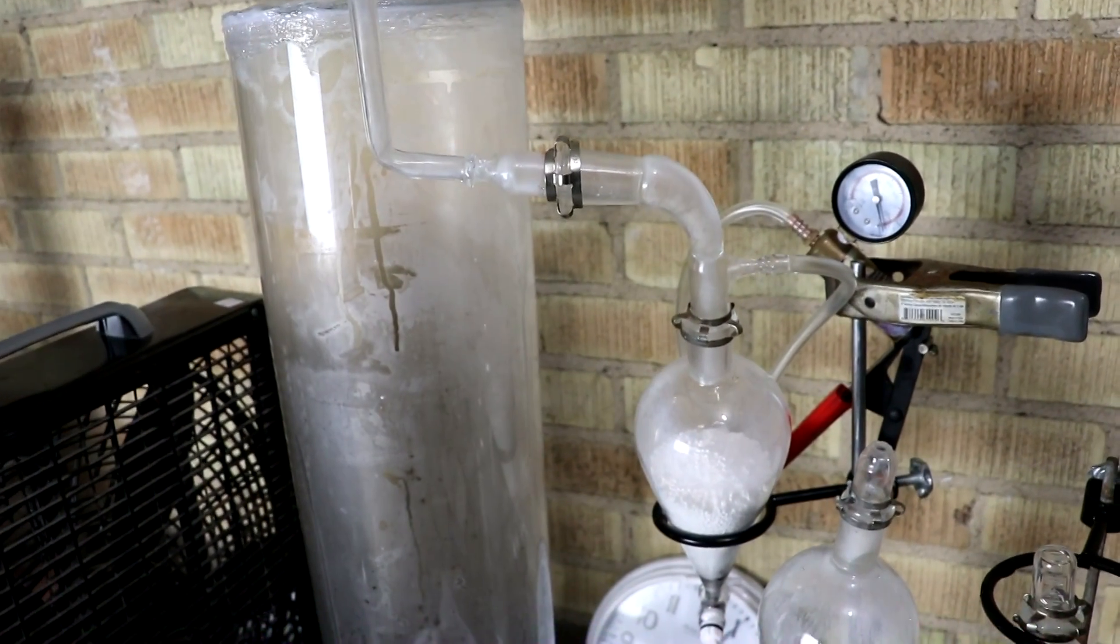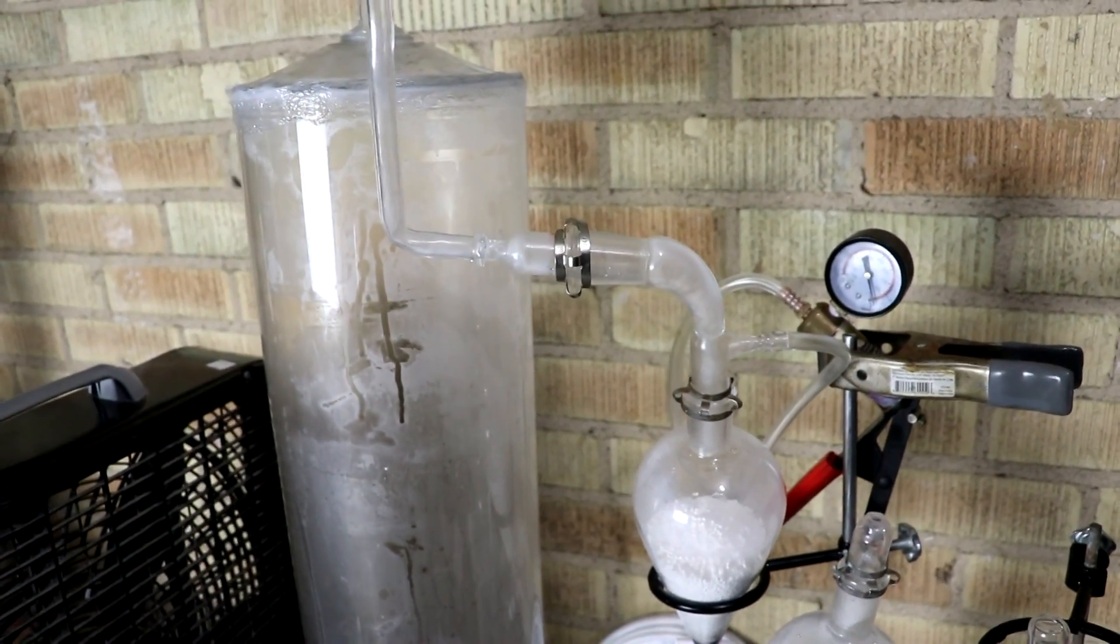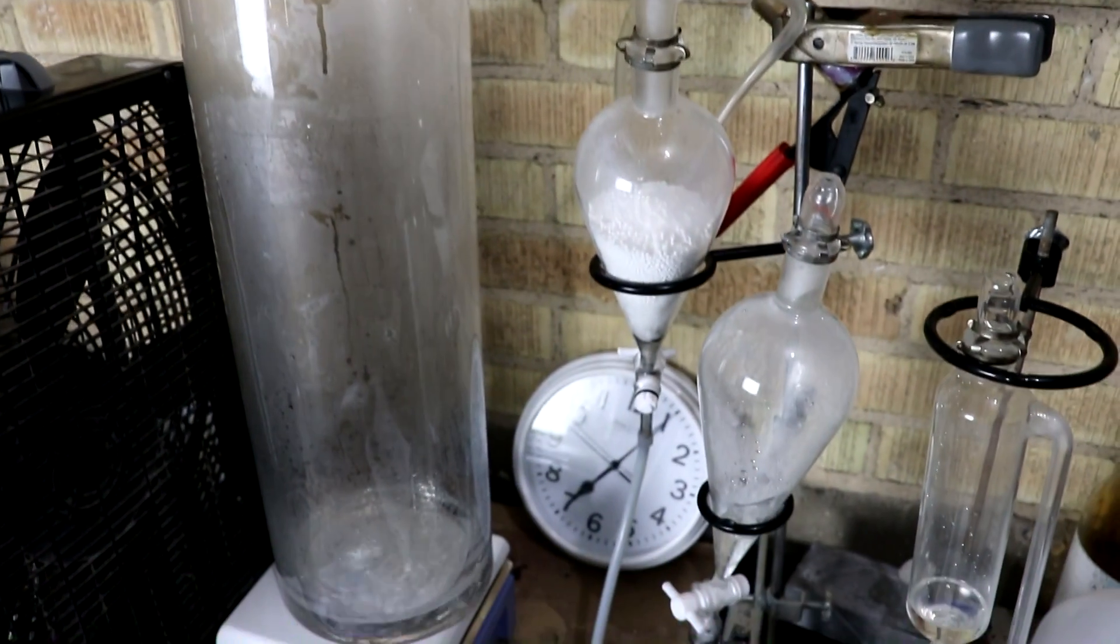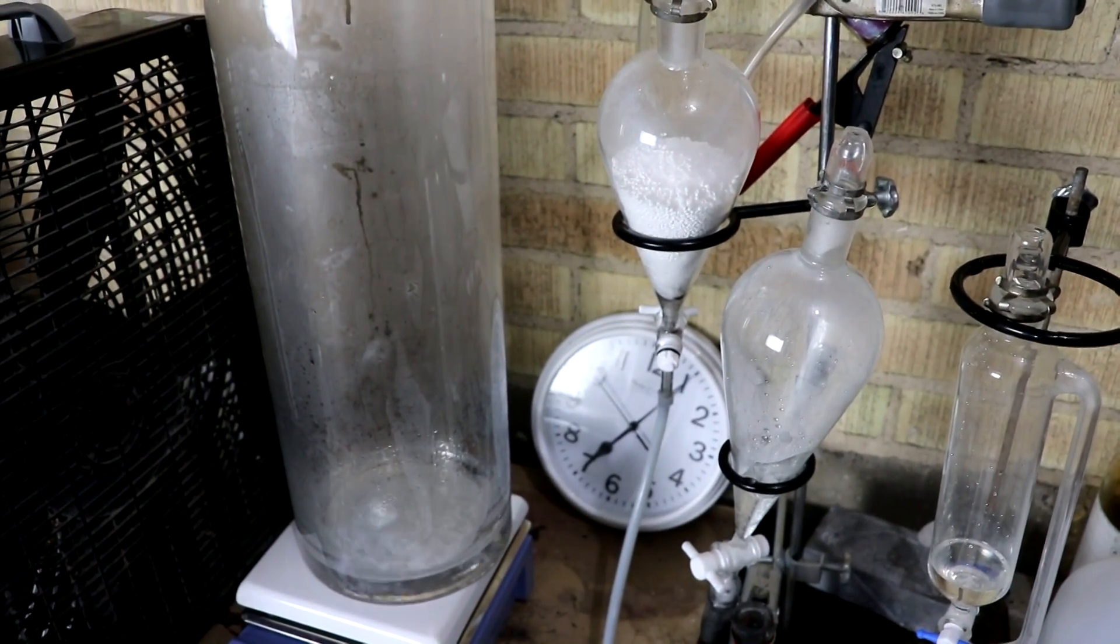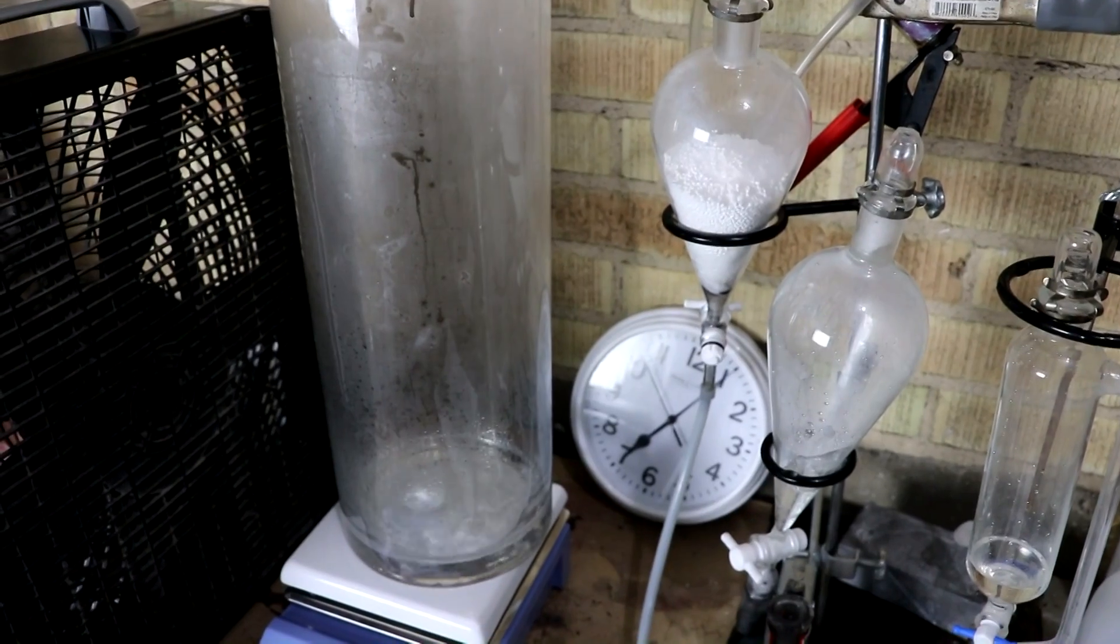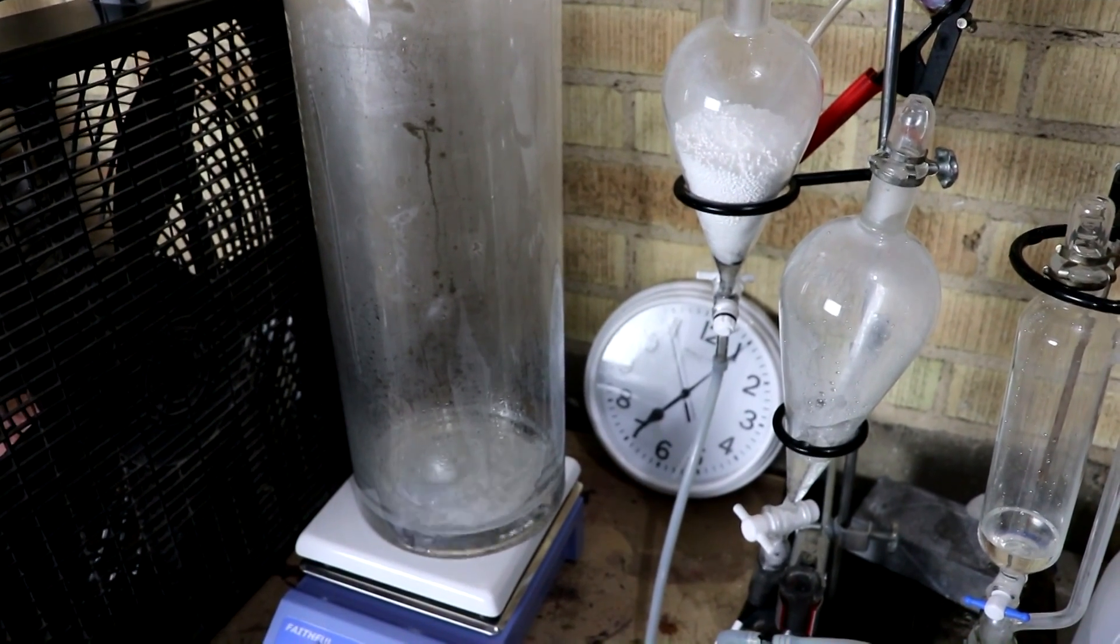If that's the case, it is going to be kind of hard to tell when this is done. So I'm just going to give it another hour. And then, whatever it's got then, I think is what we've made.